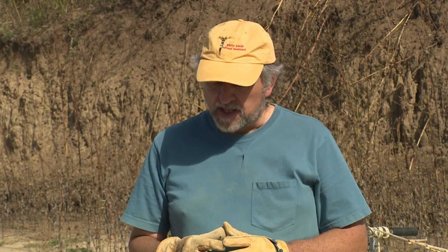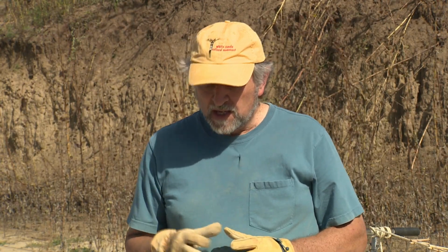In preparing the clods for shipment, we typically dip them in saran resin to stabilize them and to prevent them from falling apart or from drying out in transport. That's done by taking powdered saran and dissolving it in acetone, and then dipping the clods in that solution and allowing that to dry, and then bagging that dried saran-coated clod and putting it in a box of appropriate dimensions. The saran comes in two different concentrations.